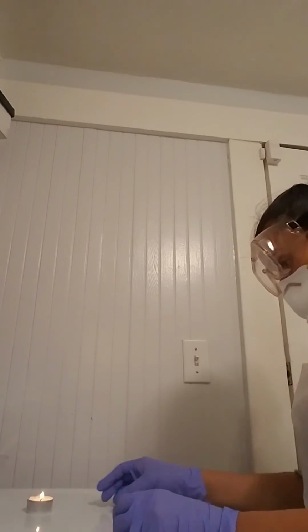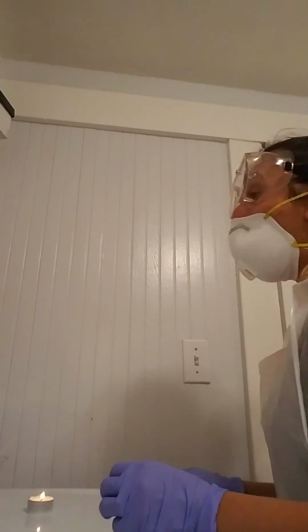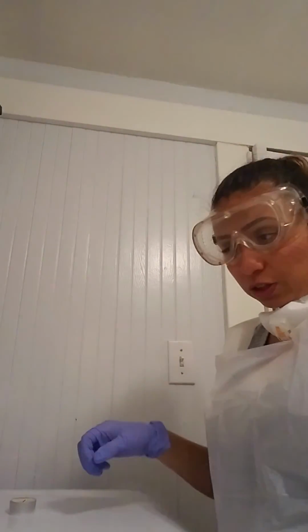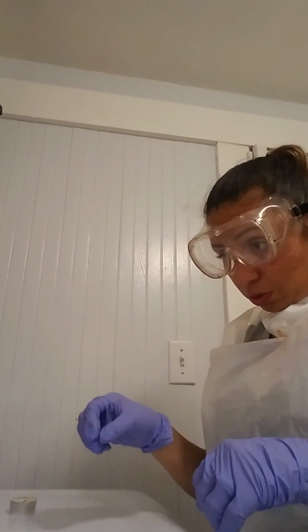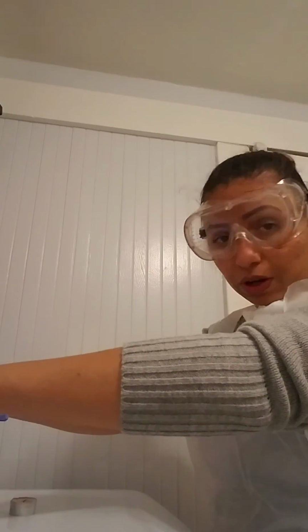So now I will go ahead and incubate my vials for 48 hours and see what the result is, and I will do a second video from that.